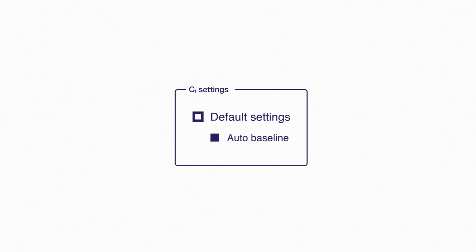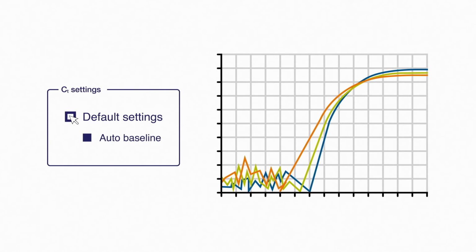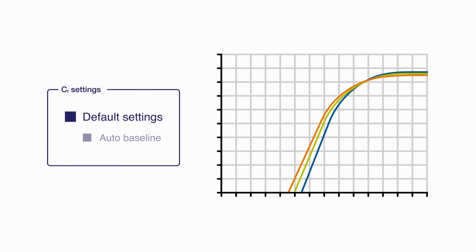With this selected, the software figures out how much noise needs to be subtracted from each well individually, and as such, generally produces the best result. So, why have a manual feature? Well, auto baseline does fail on occasion, especially with some SYBR assays and non-standard chemistries.